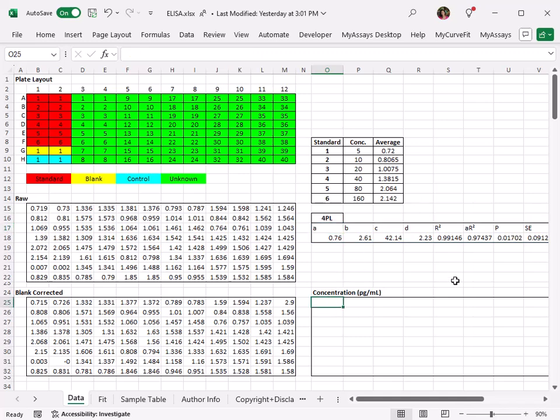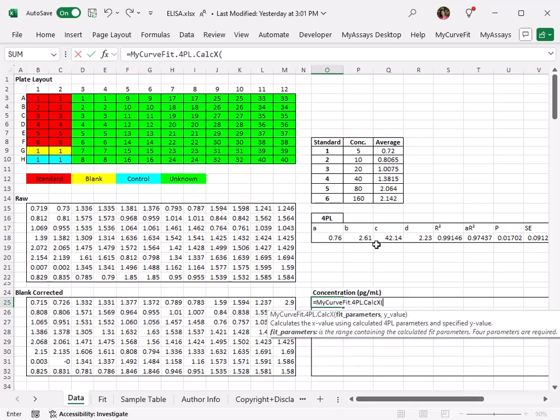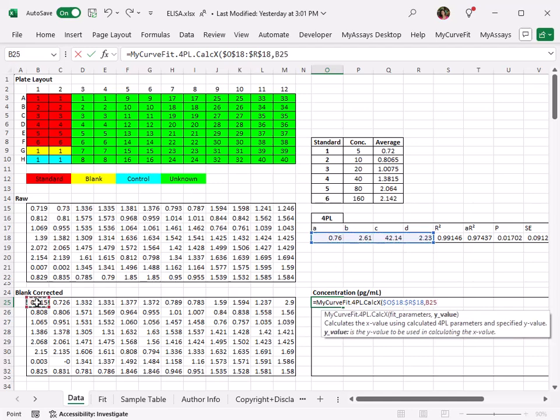To do this, I'll type equals myCurveFit and select the 4PL CalcX option. I'll highlight the cells containing the CurveFit parameters A, B, C, and D. Press F4 to denote this selection as an absolute reference. This way, when I drag the formula to fill the remainder of this matrix, the parameters will reference these same cells each time. Next, I'll highlight the corresponding Y value and press Enter.